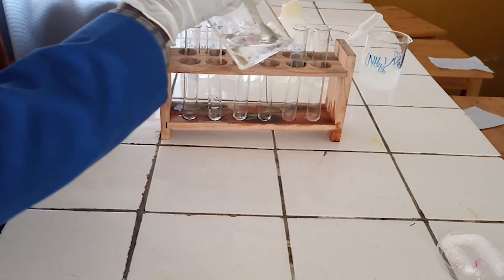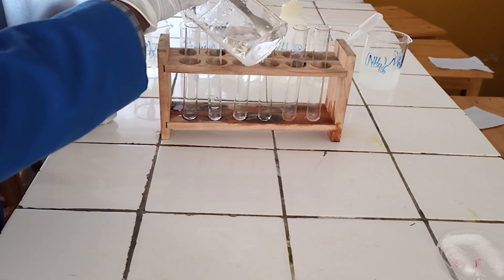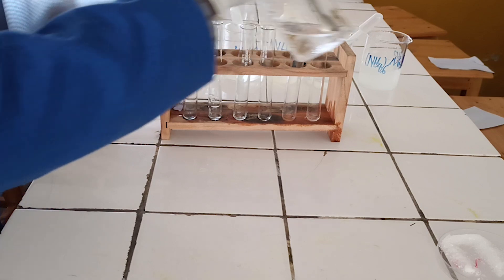Step 2: Divide the solution into test tubes. Pour around 5 milliliters in each test tube.